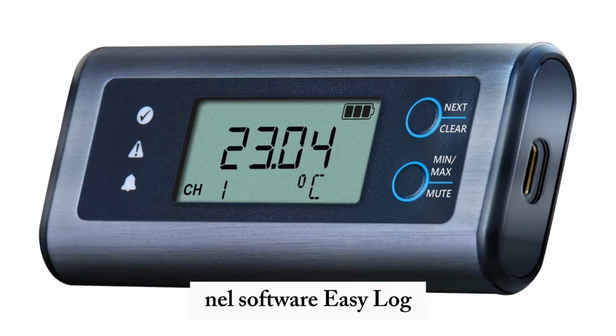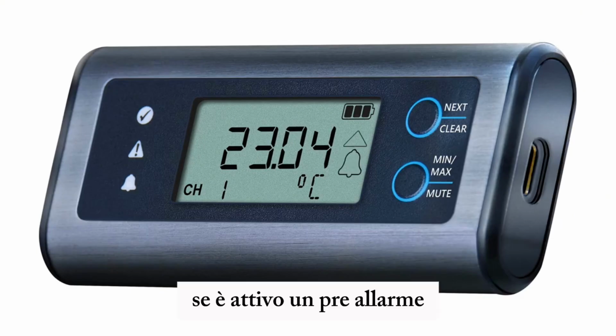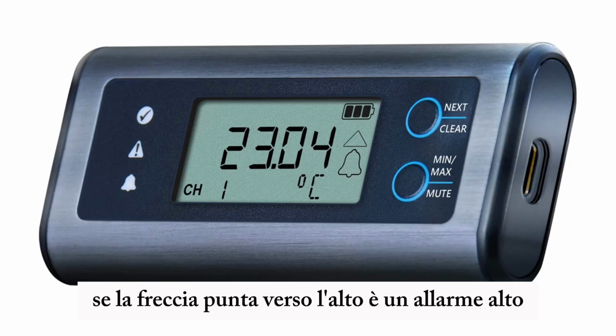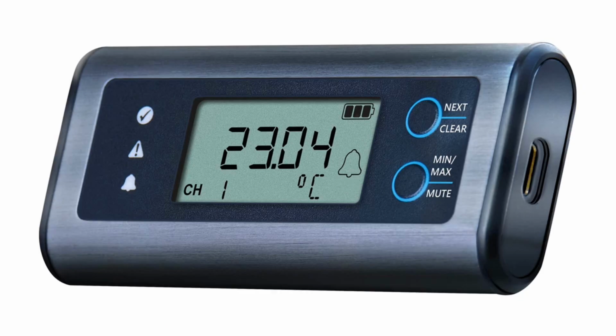In the EasyLog software you can set a number of alarms, and these alarms all have different symbols in the EL-SIE screen, indicating to the user which alarm has been breached. If a pre-alarm is active, you will see a bell and a hollow arrow. If the arrow is pointing up, it's a high pre-alarm. And if the arrow is pointing down, it's a low pre-alarm.